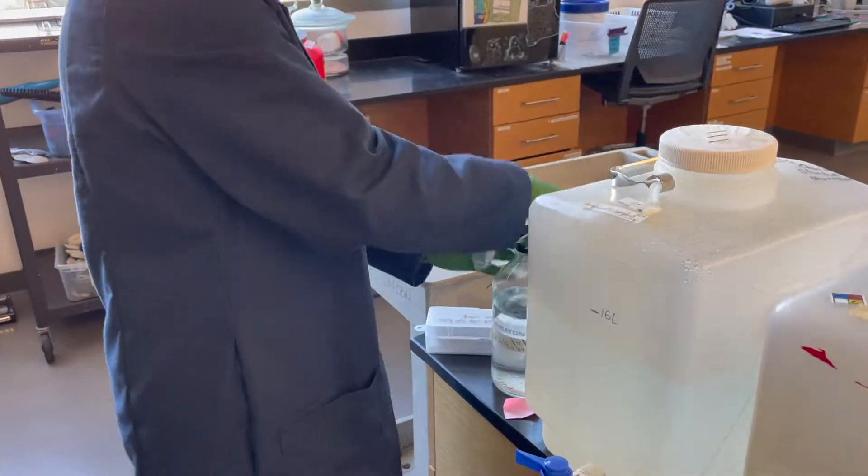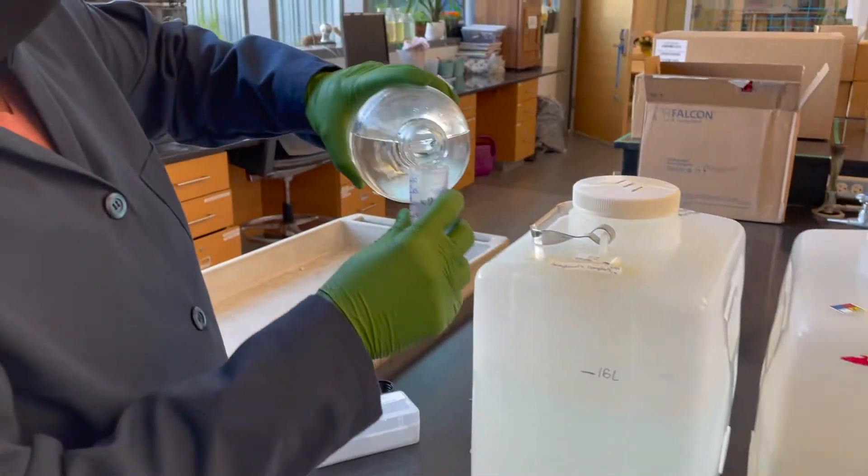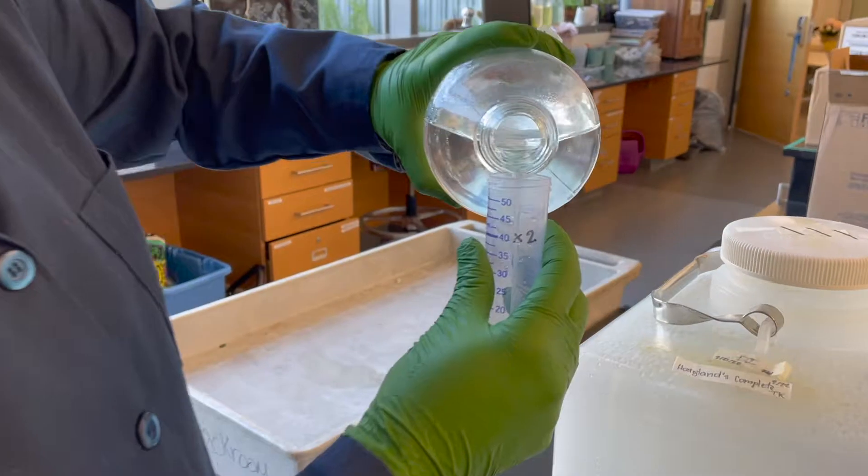The first chemical we're adding is 80 ml of calcium nitrate. I'm working aseptically here.